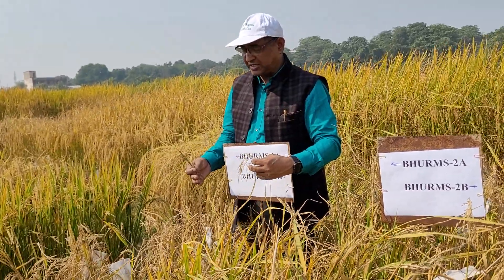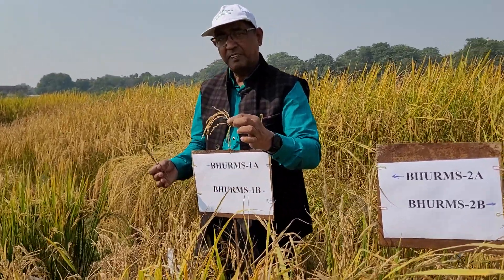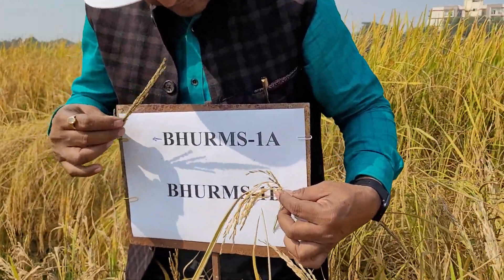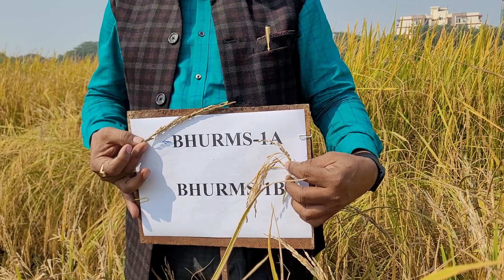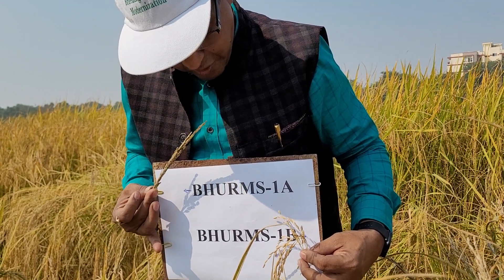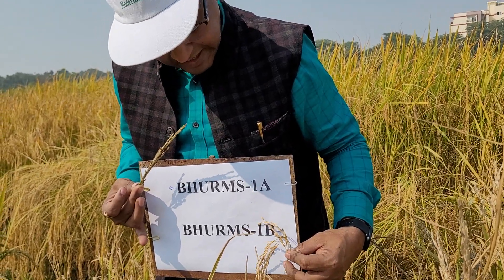Here I have germplasm 1 — the normal version — and next to it we have the line already converted by 6-7 generations of backcrossing with germplasm 1. You can see germplasm 1 has all filled spikelets, while the converted CMS line has all sterile spikelets — it is straight and not filled. That is the B line. We are naming our lines BHUR — Banaras Hindu University Rice — male sterile line 1A, with the male fertile maintainer being 1B.